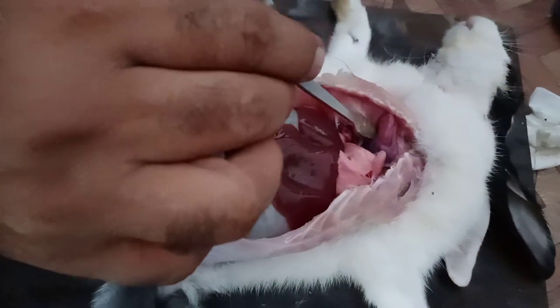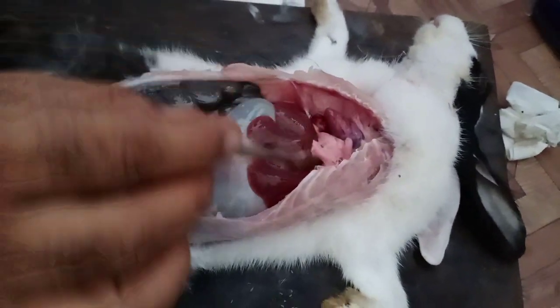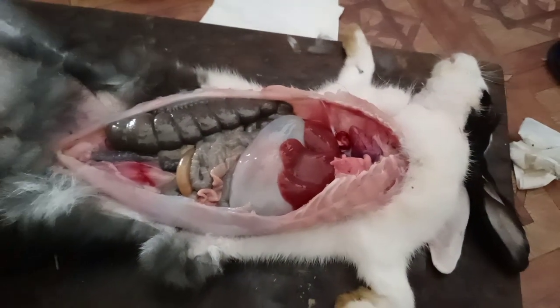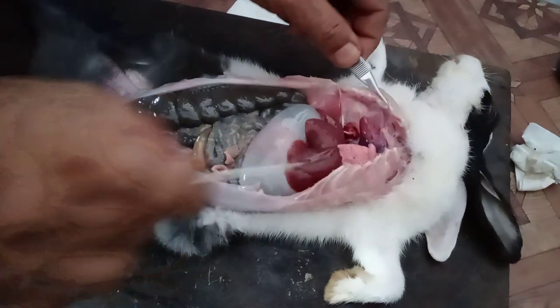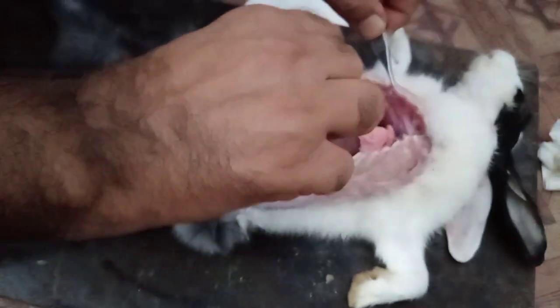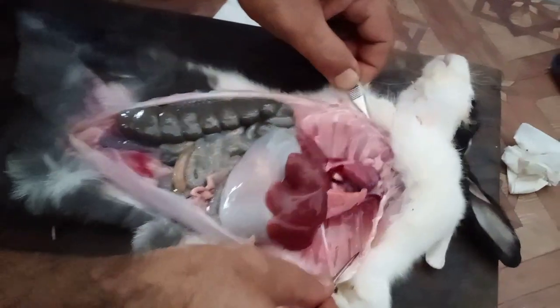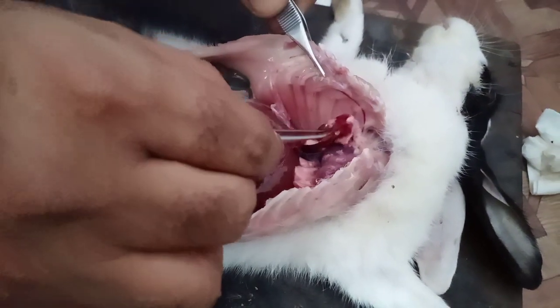Look, this is the heart — this is the heart. This is the lung, you can see — this is the lung. This is the left lung, and this is the chest cavity. This is the right lung.